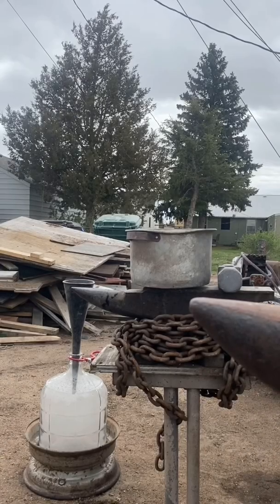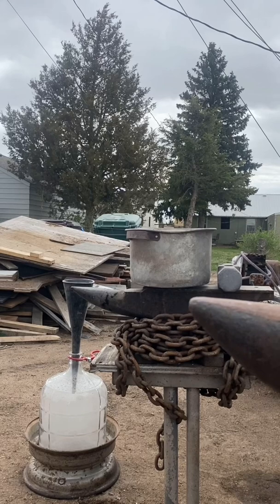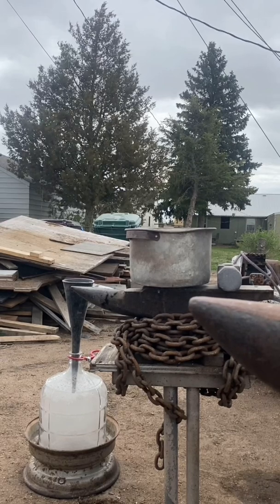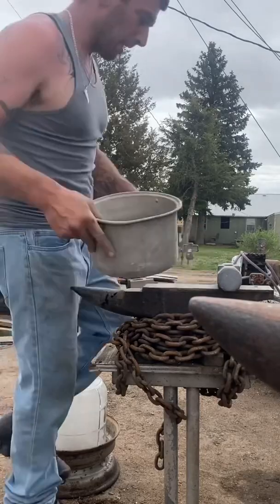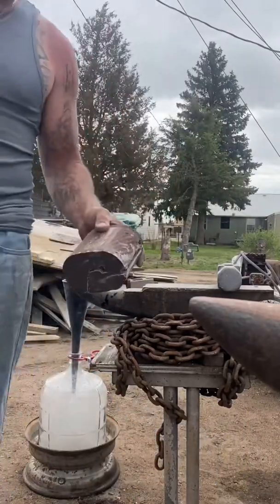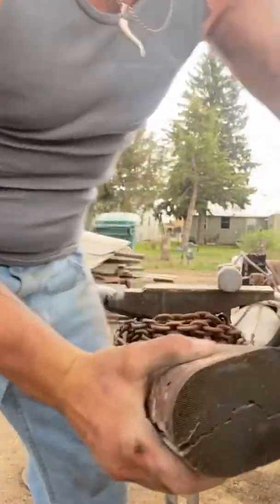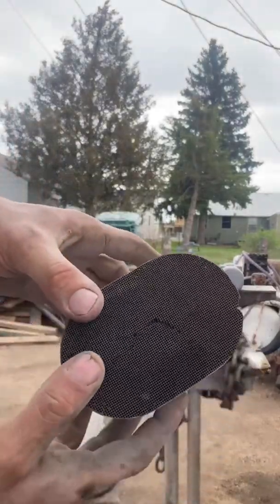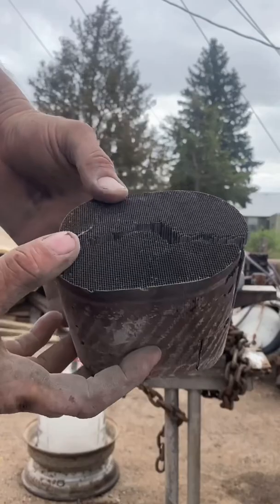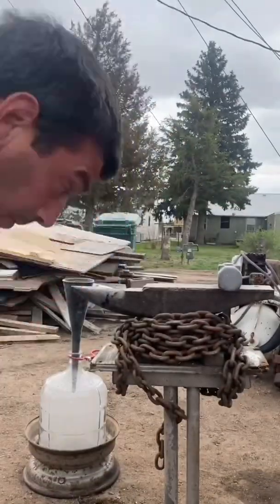Busted out the old anvil, hand smashing this palladium up. All these cats started raining so I'm on my last one. I'll show you guys real quick — this one might be in the way. There's one of the cats right there. That's a big one but I'm gonna crush it up real quick.